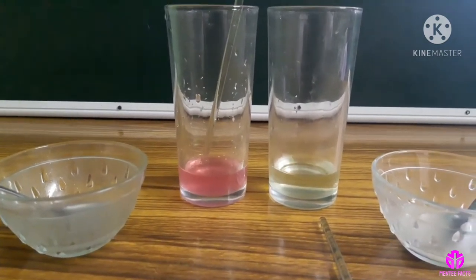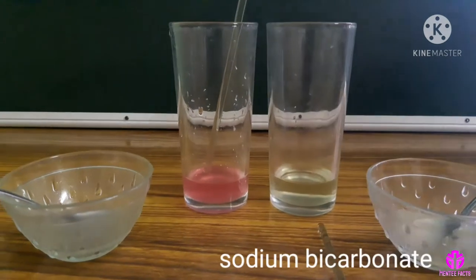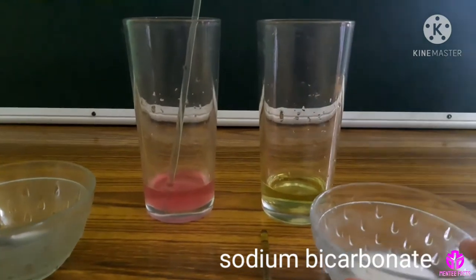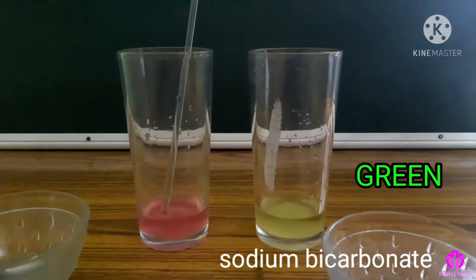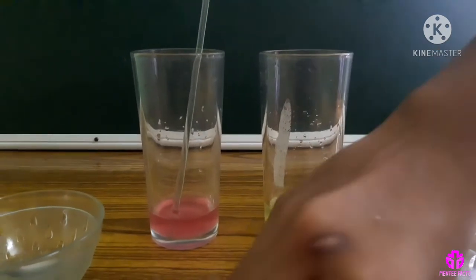In the second glass, add sodium bicarbonate solution — the colour changes to green. Sodium bicarbonate is basic in nature, so it exhibits green colour.